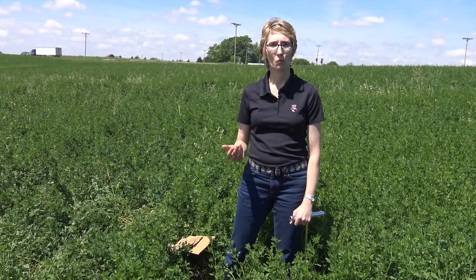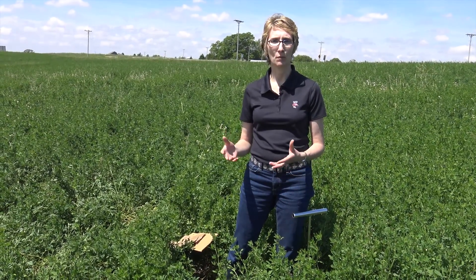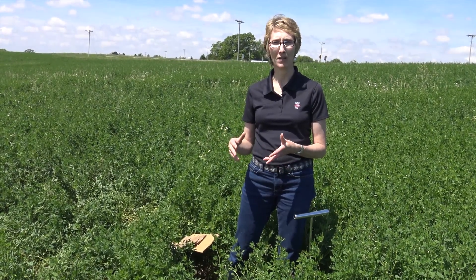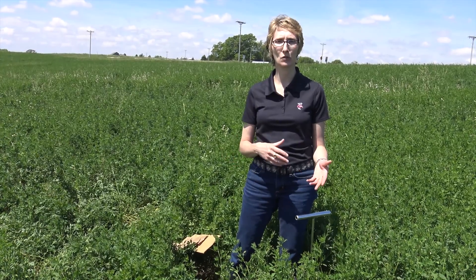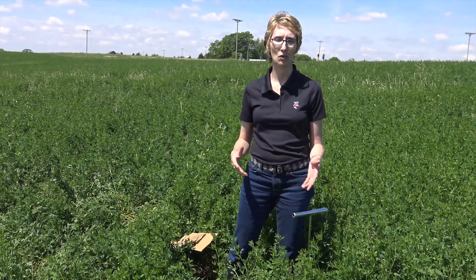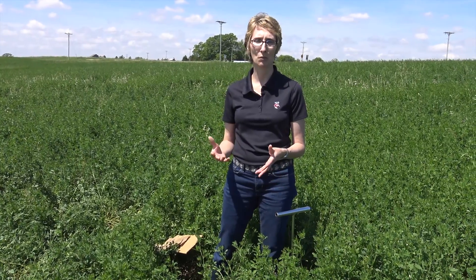At the UW lab, when we're analyzing the plant sample, the cost is around $25 and that includes the soil sample with it. So we're encouraging you to take the companion soil sample along with the plant to help better diagnose your field.